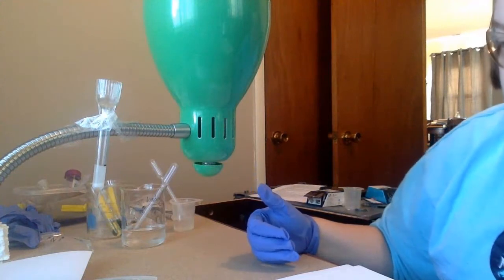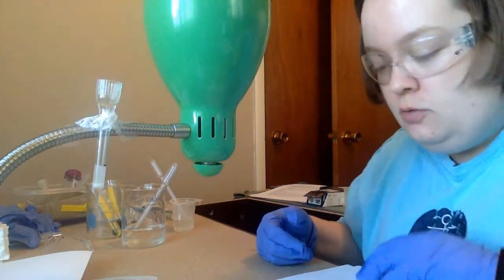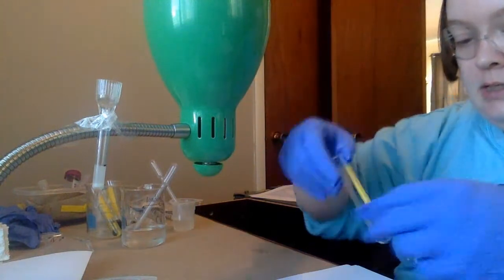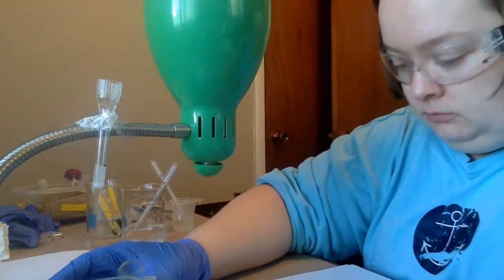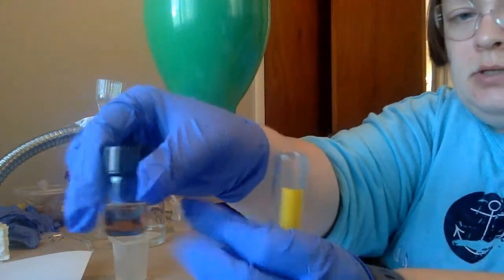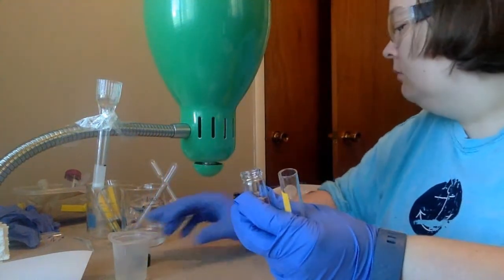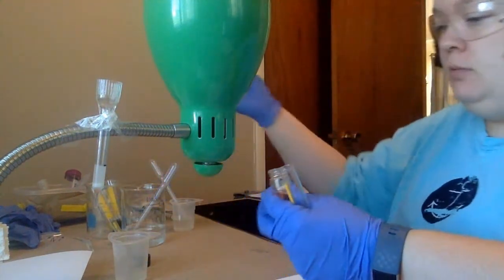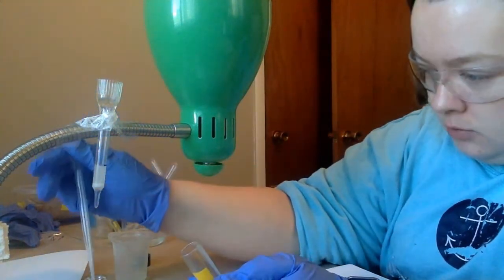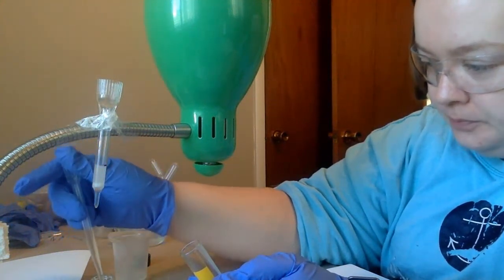All right, so we just stopped dripping. So it says place a new test tube under the column. So I'm going to get me an empty test tube. And I am going to add this substance that we had from experiment 1, my brown substance. So I'm not going to inject all of it. I'm going to take about half of it or so here.